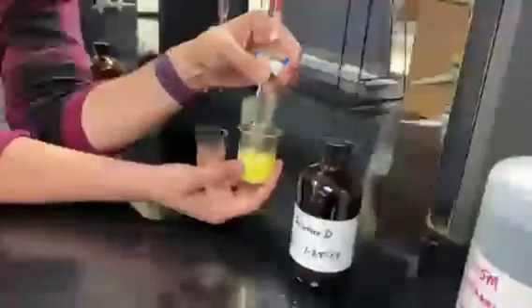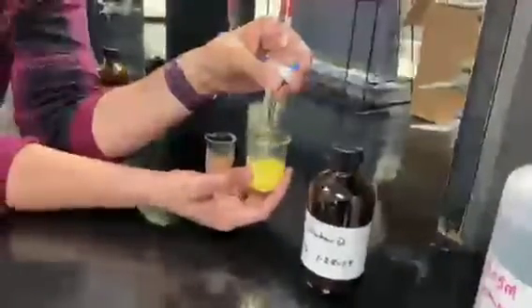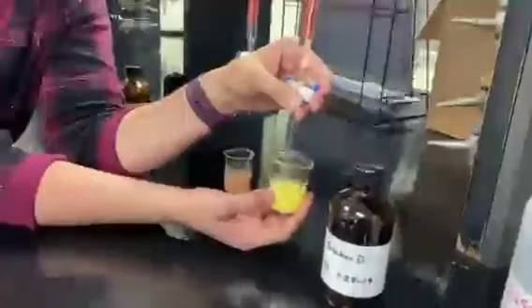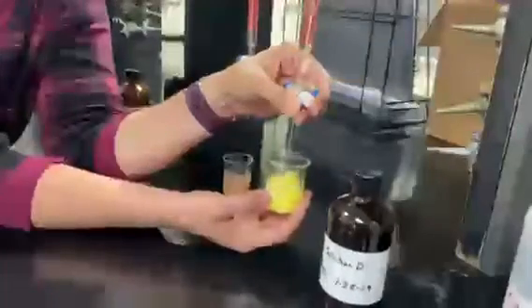Keep adding, again, more flashes, and add a little bit faster since this one's seeming to take a little bit longer than the others. Taking a little more volume than the others with that common ion on the acetate present.